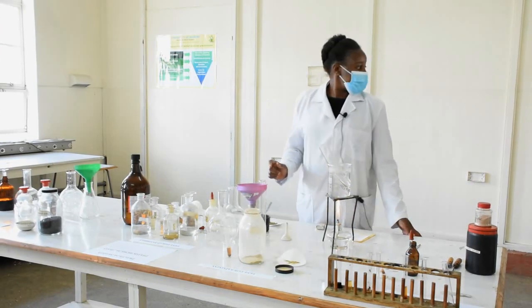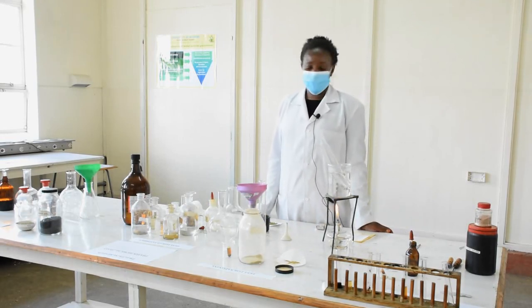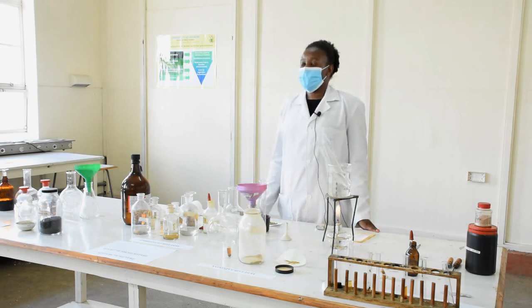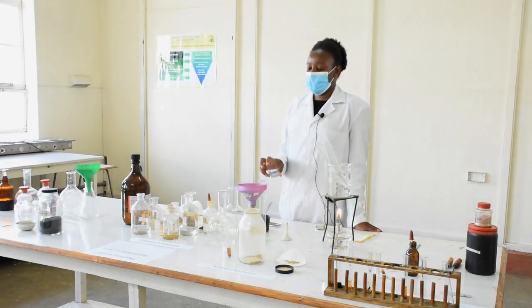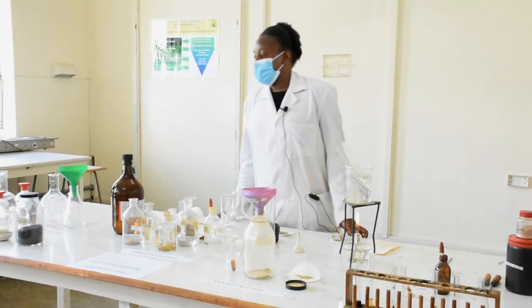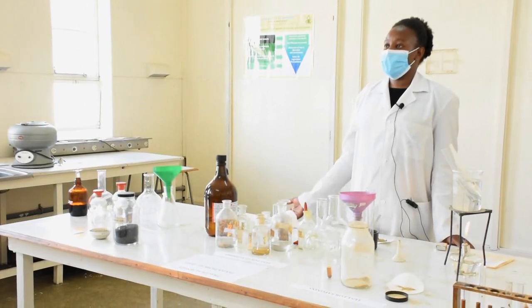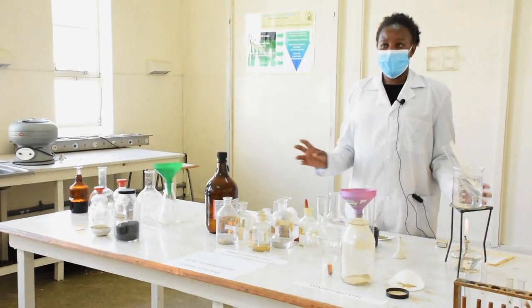The other phytoconstituents we are looking at are the glycosides. There are various categories, so mainly we will look at cardiac glycosides. We will use color reagents — the nitroaromatic compounds that we react with cardiac glycosides, especially of the cardenolide type, to give various colors. And lastly, we'll test for presence of alkaloids, which give various colors when reacted with various reagents.